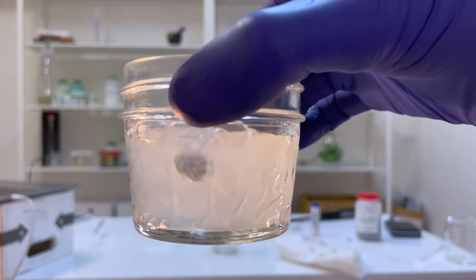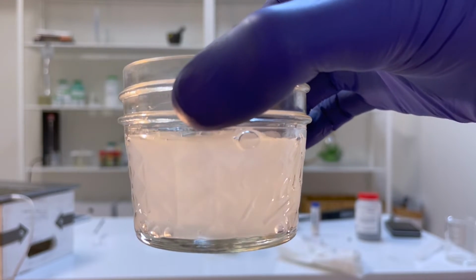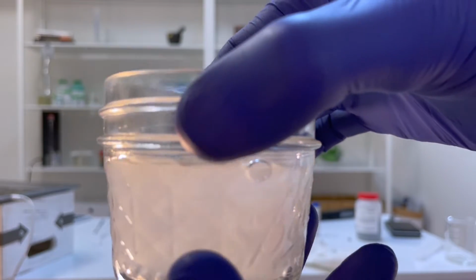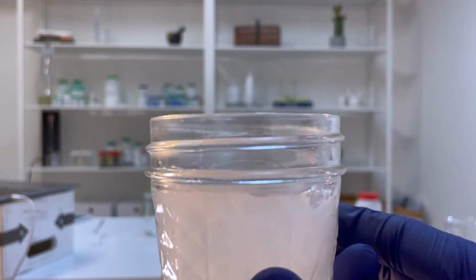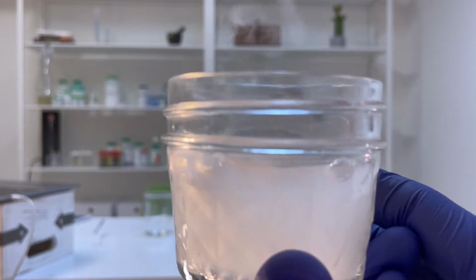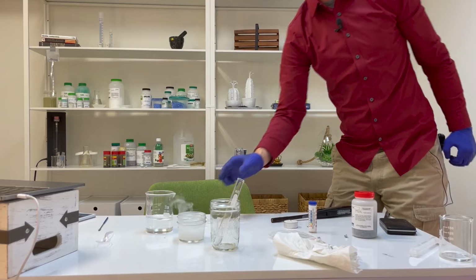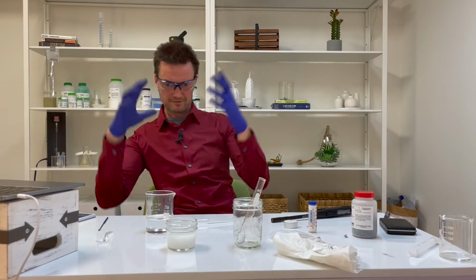So you should not be holding this up in the air. Just set it in your pie pan in case it spills over, but you can see this is quite vigorous. It's actually getting kind of warm, so I'm going to go ahead and set it down. That's putting out a lot of fumes.